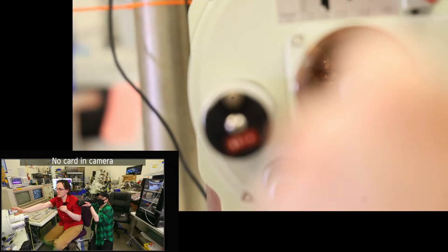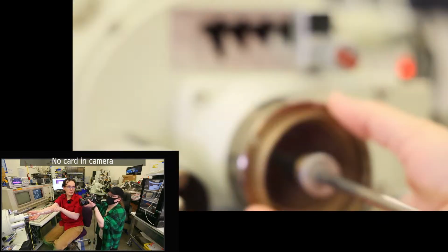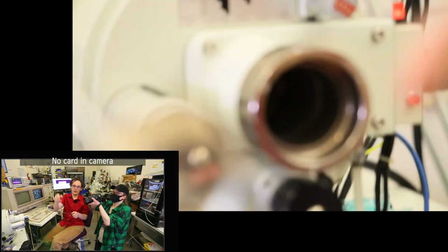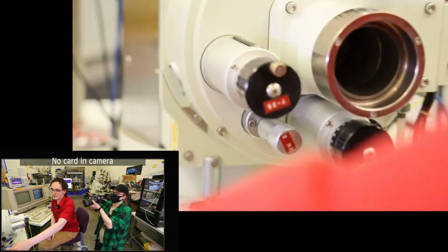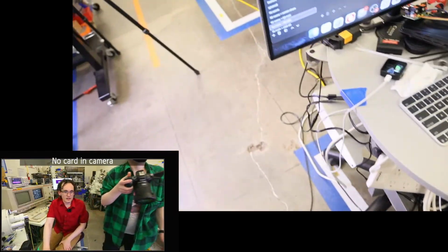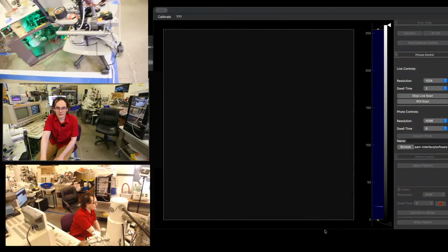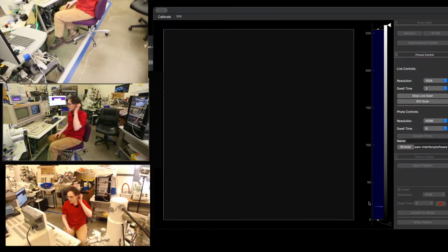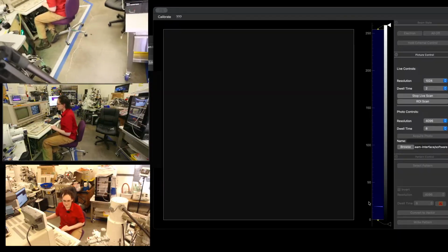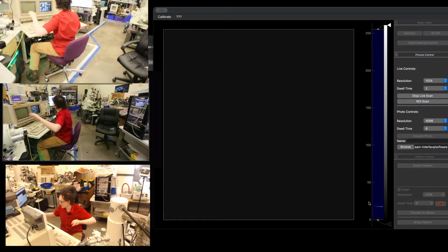Cool, so let's close our gate valve. And there we go. And we can just put the camera back on the regular tripod now. Okay. So we got a sample on the microscope, so we can switch back to that, and let's go ahead and get ourselves a beam. Bring the sample up to the height we're going to use. It's going to be approximately 15 millimeter working distance.